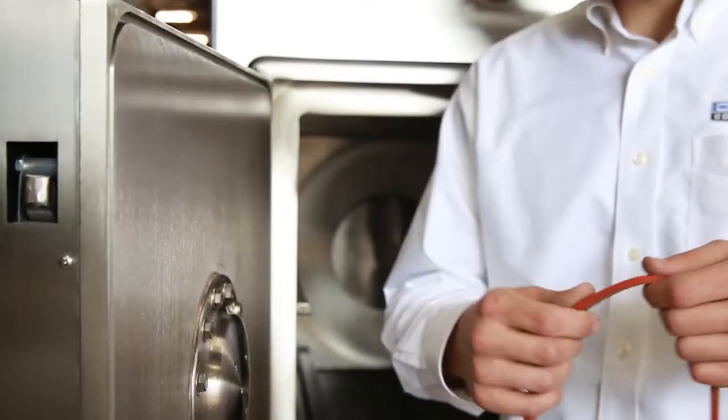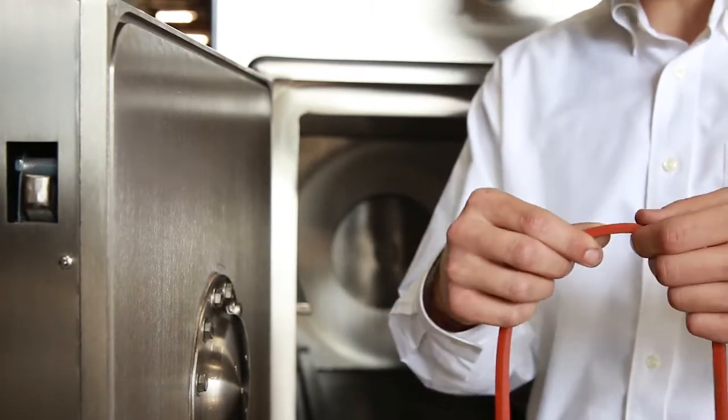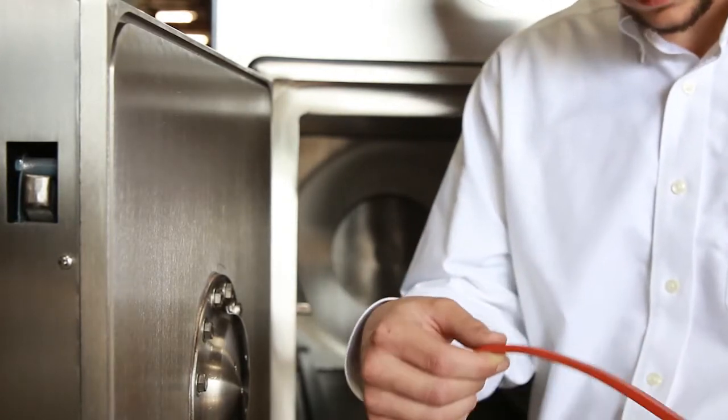The next step is to install the new gasket. You'll need to find the seam of the gasket and place it at the top near the center.